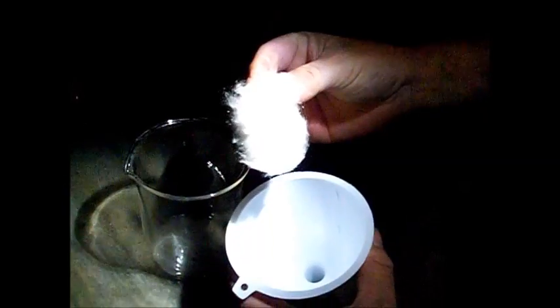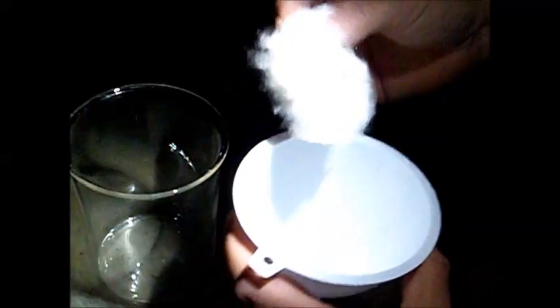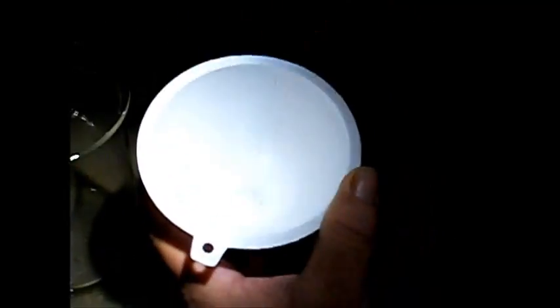What I'm going to do is use ceramic wool called Kaowool - any fiberglass will work. Take a regular funnel and pack fiberglass down into the stem of the funnel. Pack it good and tight - the tighter you pack it, the better it works. Now you've got your fiberglass packed into the funnel, funnel in the beaker.